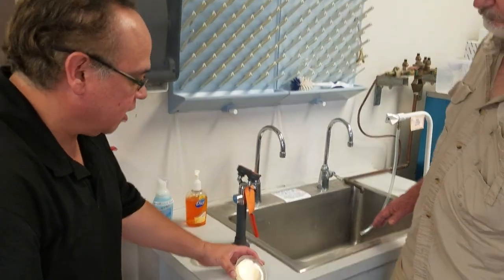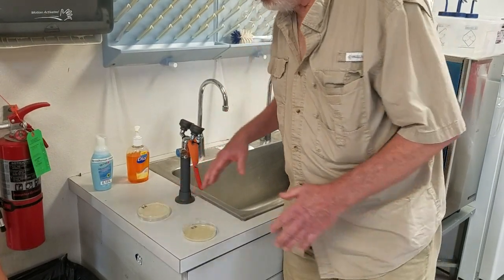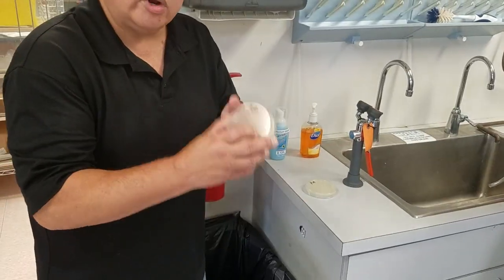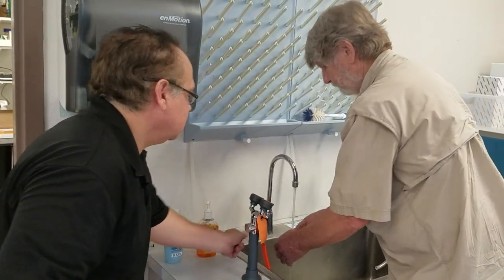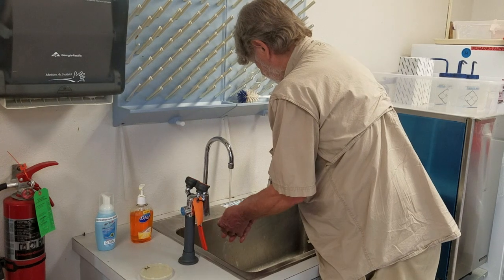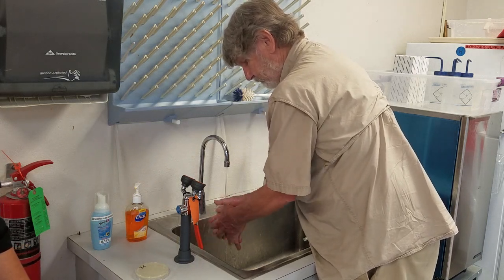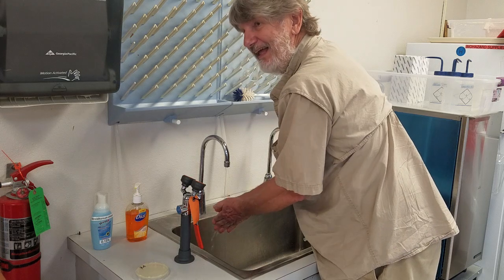I'm going to open it up and John is going to very gently put his fingers and his thumb in there. Now I have an impression of whatever was on his hands before. I'm going to turn the water on for him to minimize the variables, and he's going to wash his hands with just water, targeting about 20 seconds.